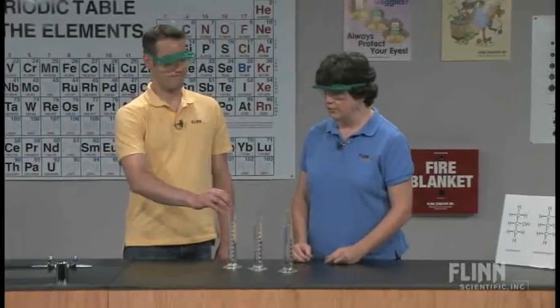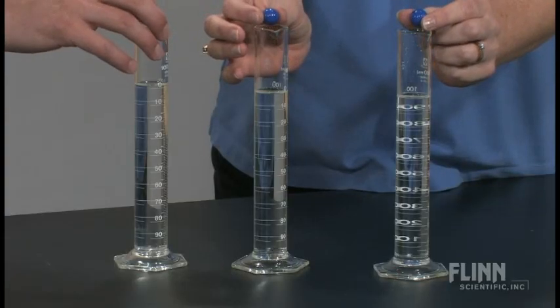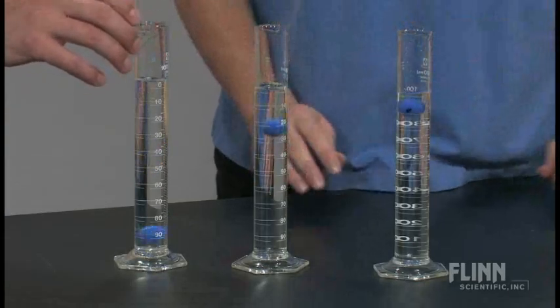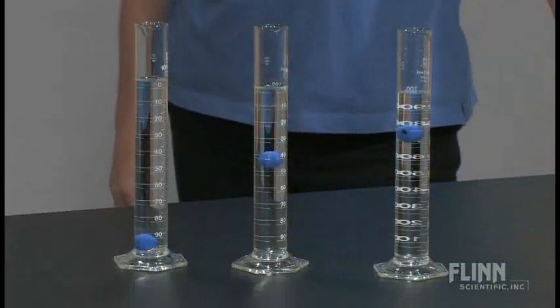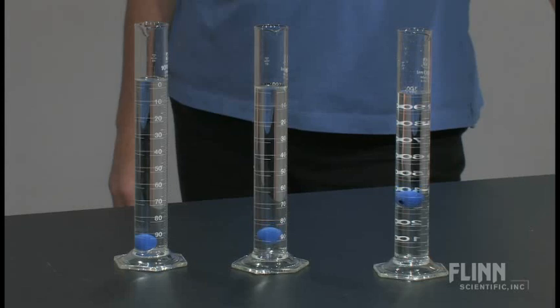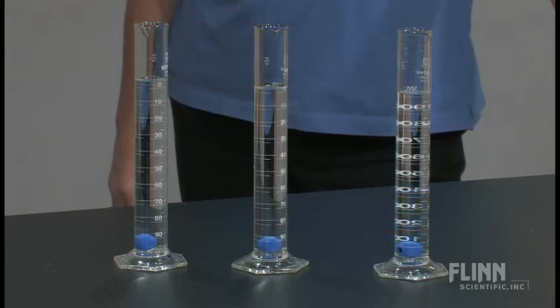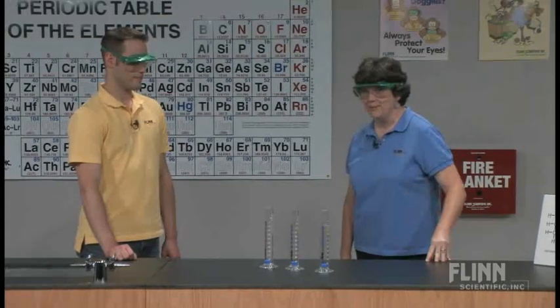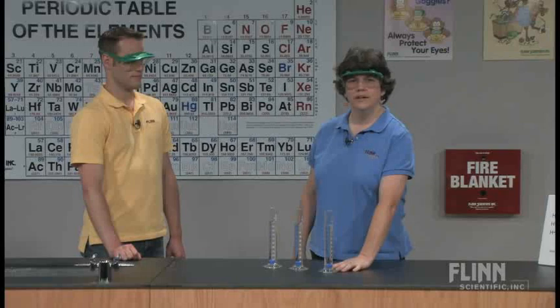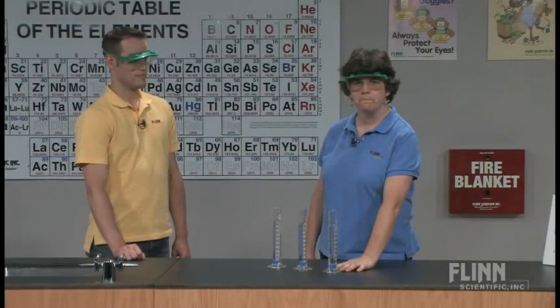One, two, three, drop. The propanol is all the way down, propane diol following quickly, and the glycerol — having three hydrogen bonding sites — takes the longest. Again, that one was a little bit doped; it was about twice as heavy as the other two. If you want, you can have them all the same mass.